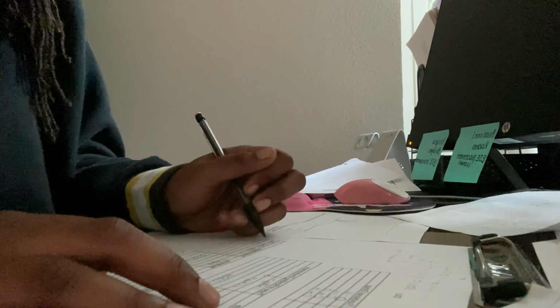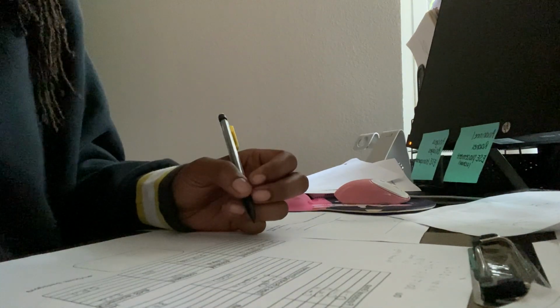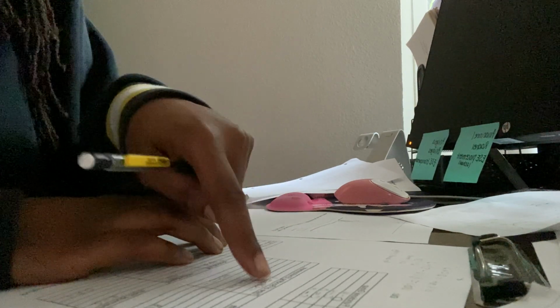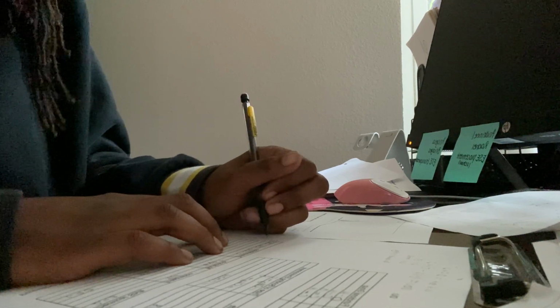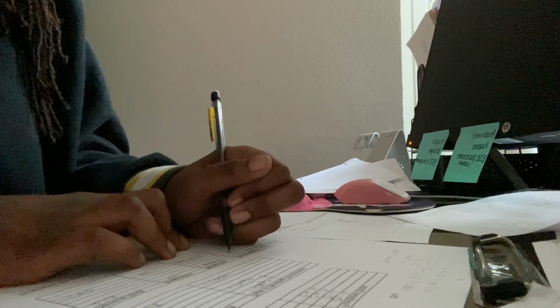I know it's 3 CH2s because this is a triplet. And I know it has to be CH2 methyl because of my previous graphs up here. So I combine this CH2. And I know one of my methyl groups, I should say, has to have a carbon connected to an oxygen on it. So do that twice.